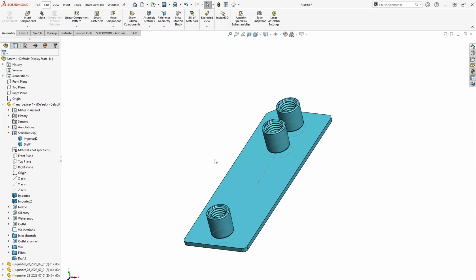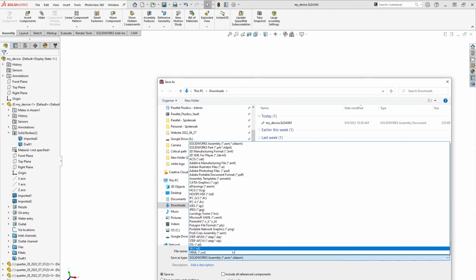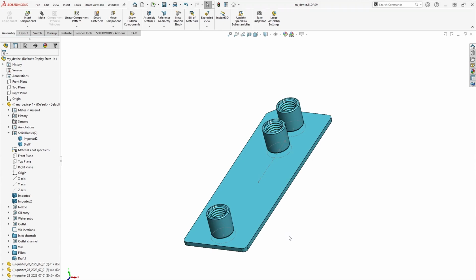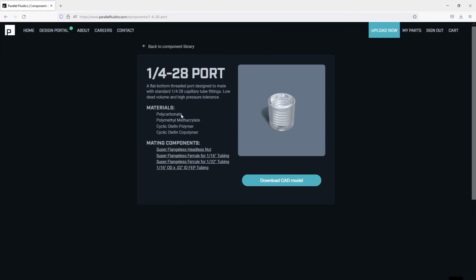The process to submit a part like this for quote is super simple. All we have to do is export the whole assembly as a step file and upload it to the Parallel website. To do so, just click File, Save As, and then select Step AP214 as the file type. Click Save, and SOLIDWORKS will export the file to the selected folder. Now we just toggle back to the Parallel website and hit the big Upload button in the top right corner of the screen.